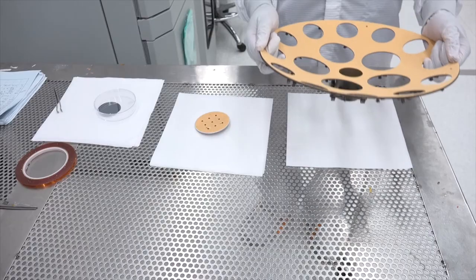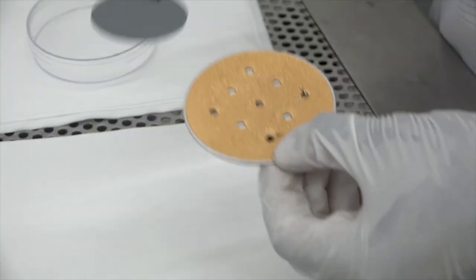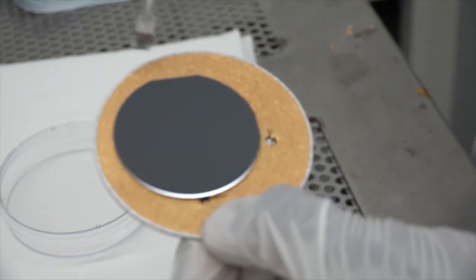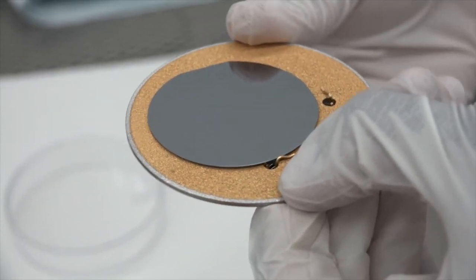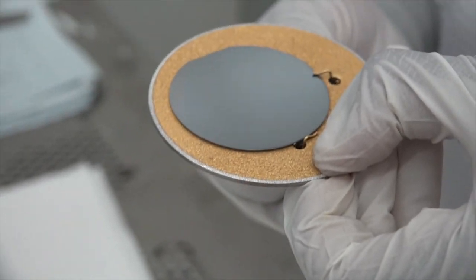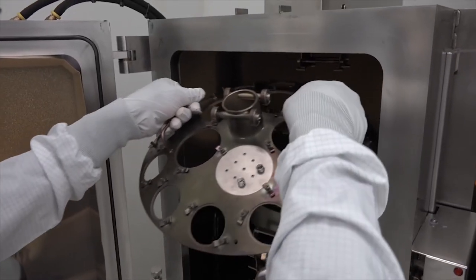Let's load our sample into the dome-shaped holder. In this example, we will use a 50mm diameter silicon wafer as our sample. We place the wafer in the holder and secure it with the clips. We reinstall the dome into the chamber.